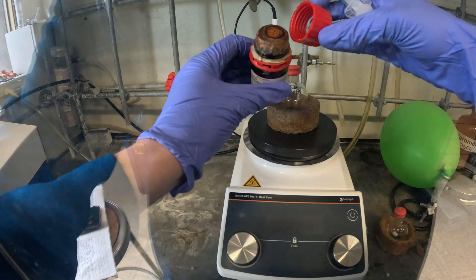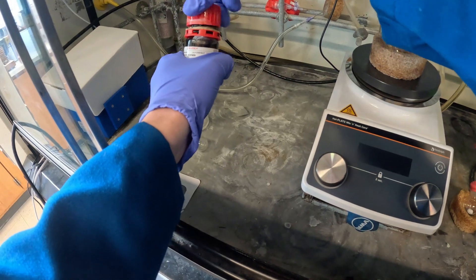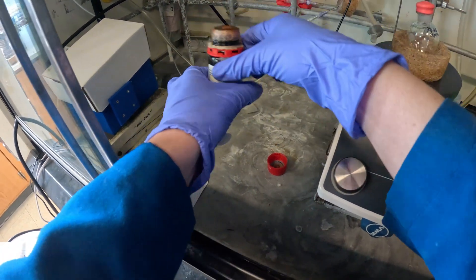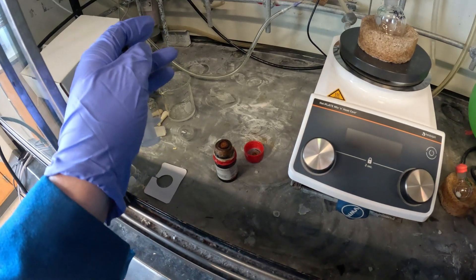That is the most disgusting bottle of BBR3 I've ever seen. But anyways, I need to do this reaction, so here we go.